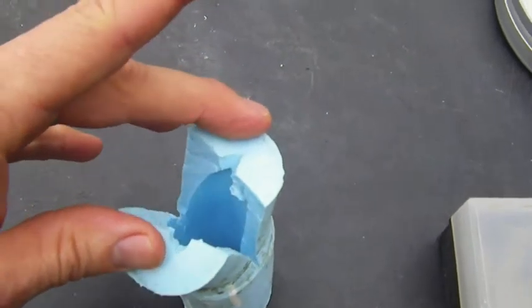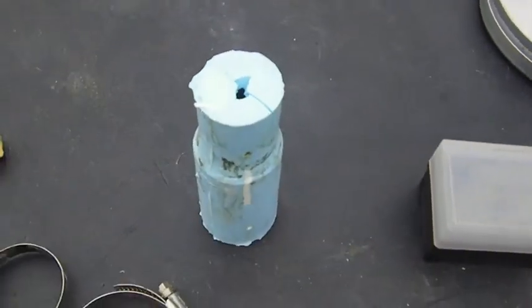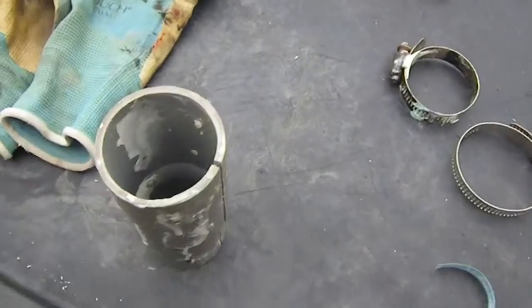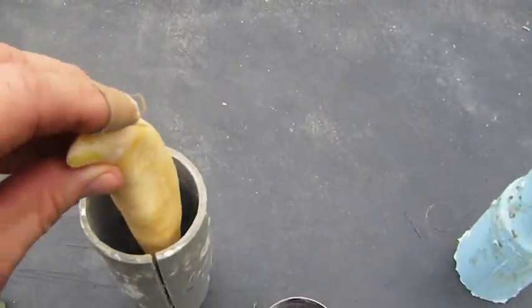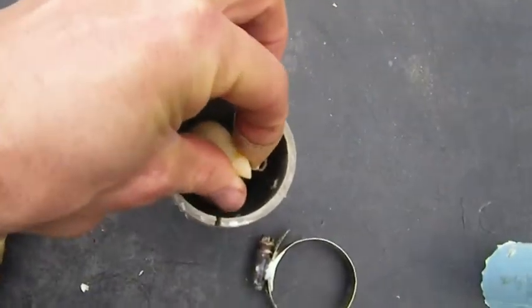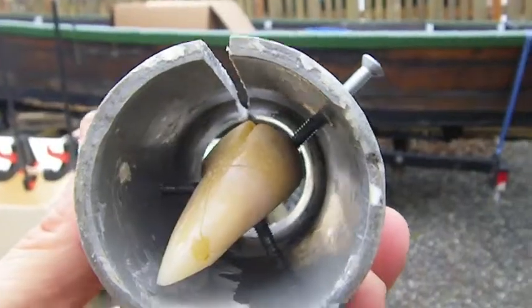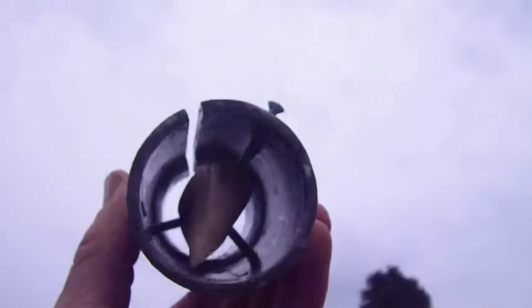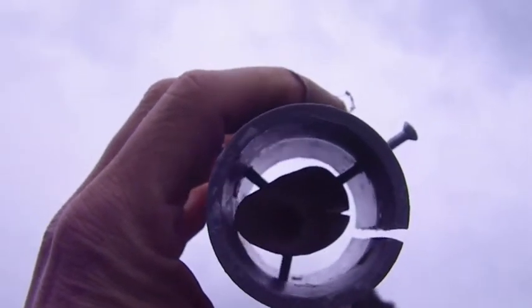Here's a mold of something else, but you can look inside and see basically that's where the original tooth would have been. Got a scale so we can measure stuff precisely. The clamps there hold this. We've got the tooth pinned in there with three pins. It's not touching any of the sides, which is good — that means that the mold material will fill in there just right.